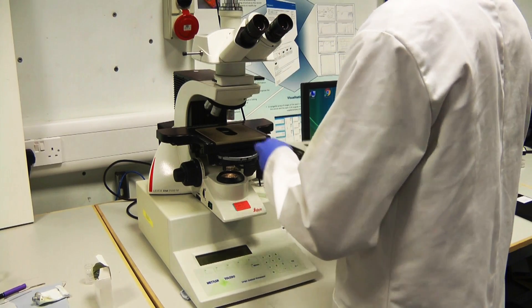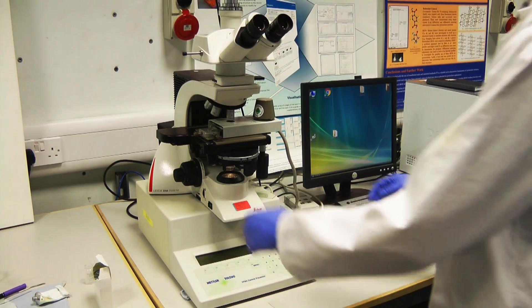Place the hot stage onto the microscope and align the viewing area by looking down the microscope.